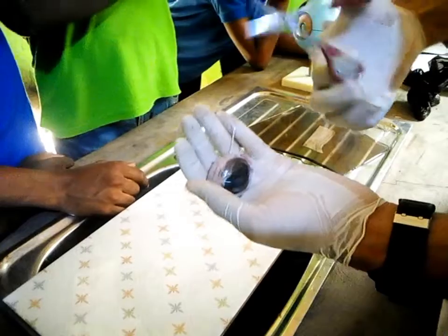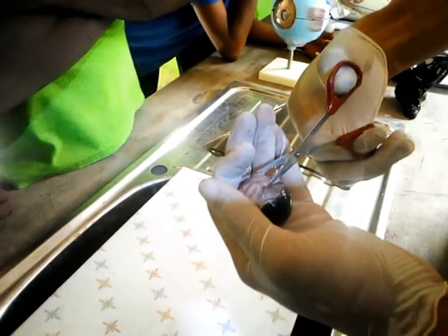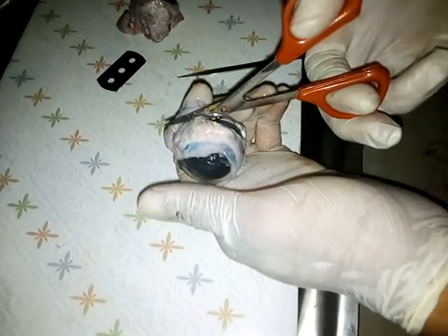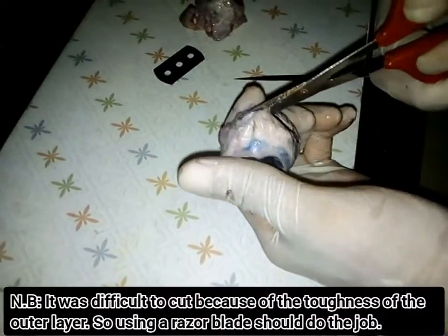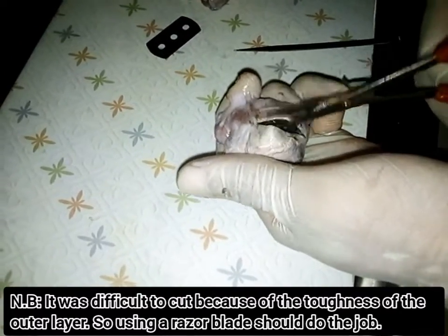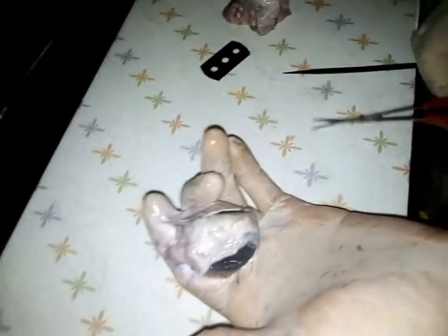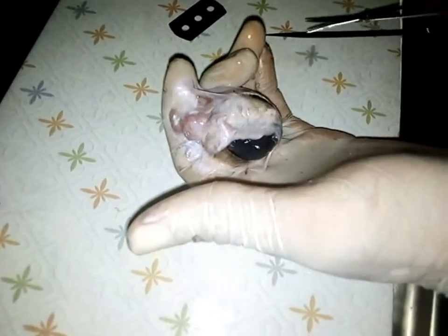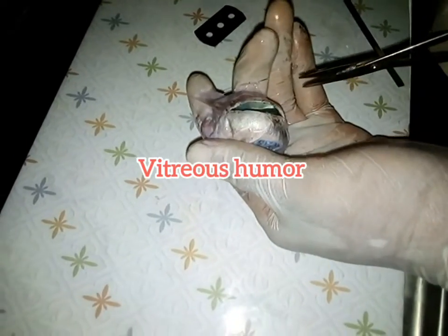Okay, now let's cut in. It was difficult for me to cut, so I had to use a razor blade. Do you understand? So you see, the fluid inside is what? It's thick compared to the one here. So the first one that gushed out, that oozed out, was what? The aqueous humor. Now that it's liquid, you can see it. Now this one that you can see now is what? The vitreous humor.